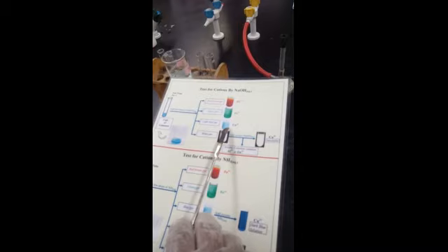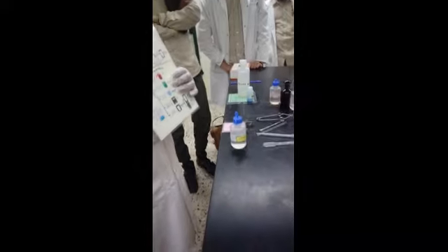Blue. So I go, okay, blue. My answer blue tells you copper 2 plus. It tells you copper 2 plus ion. So my first test is finished. I have the idea my cation is copper 2 plus. Then I go to the second test. From the first test, I got the copper 2 plus ion.